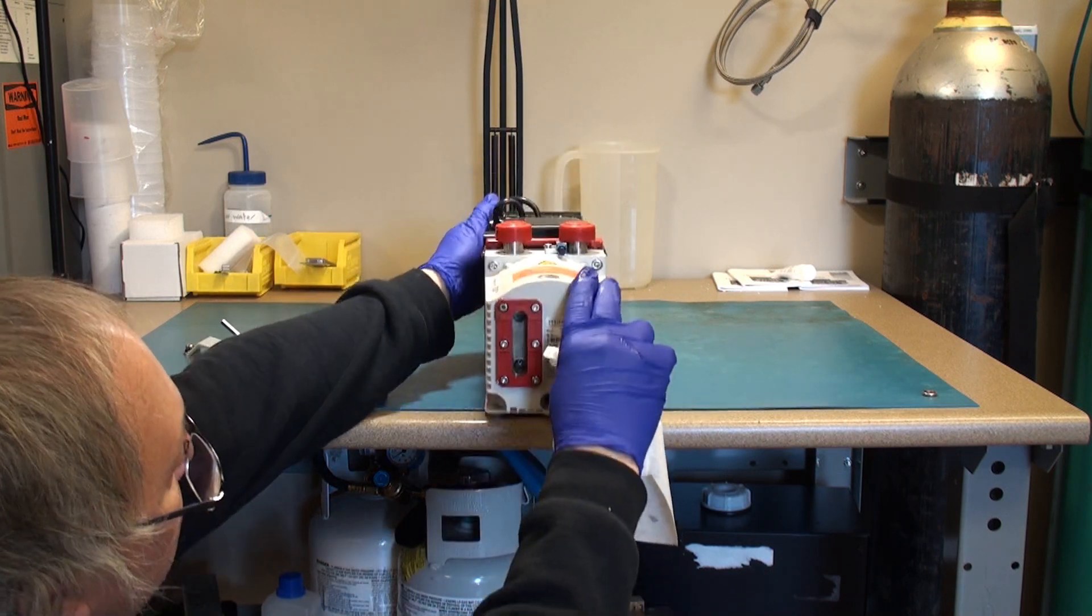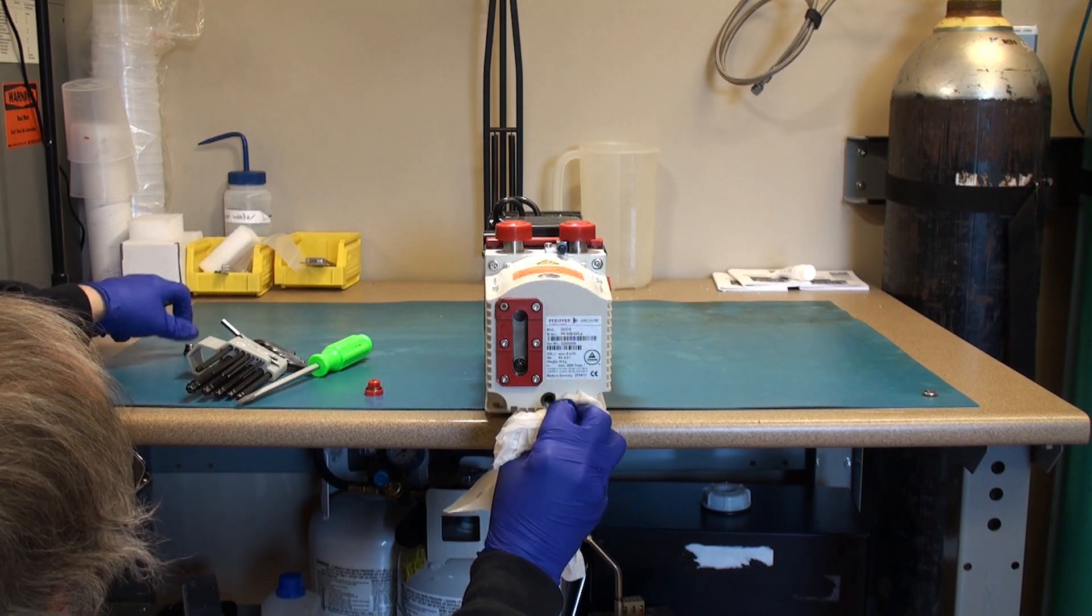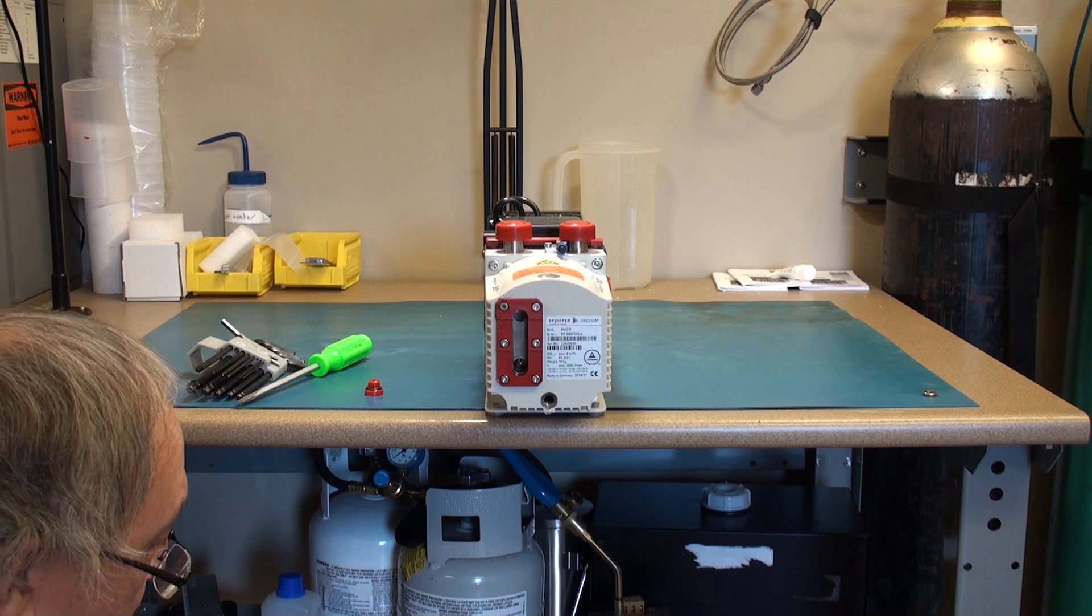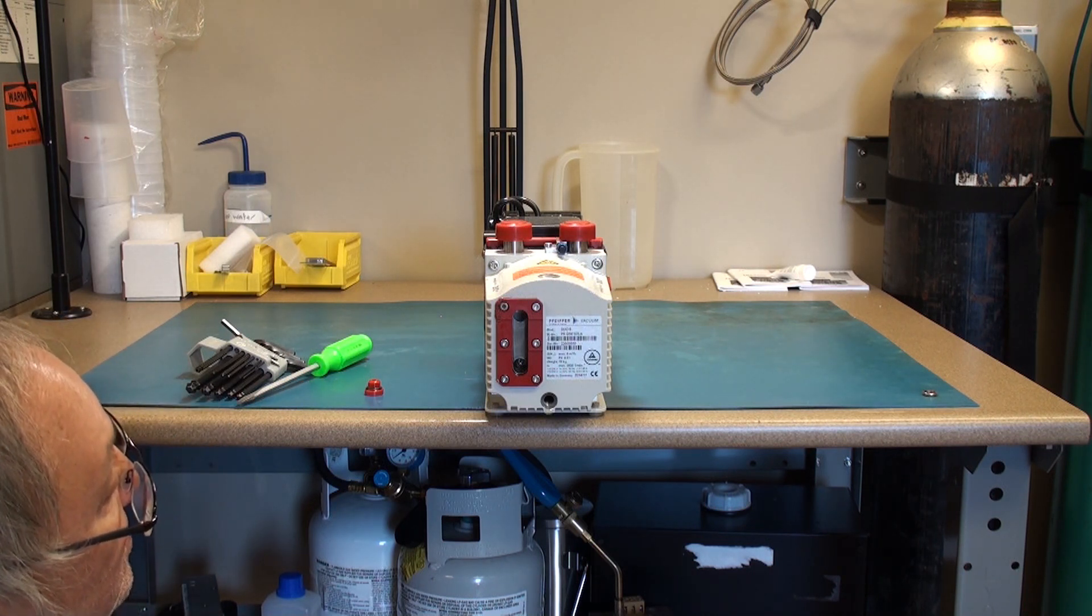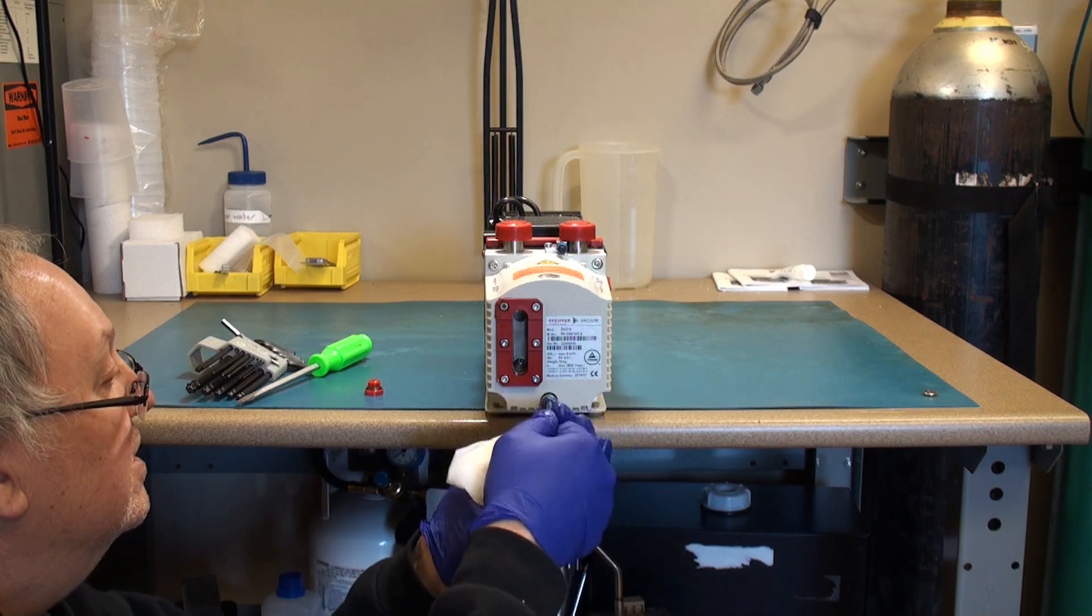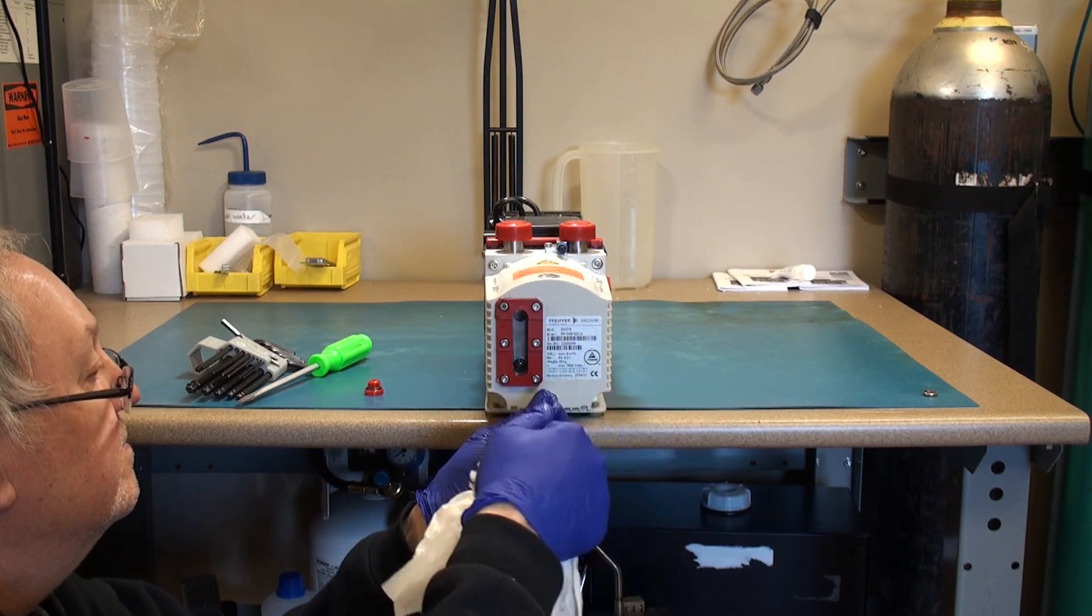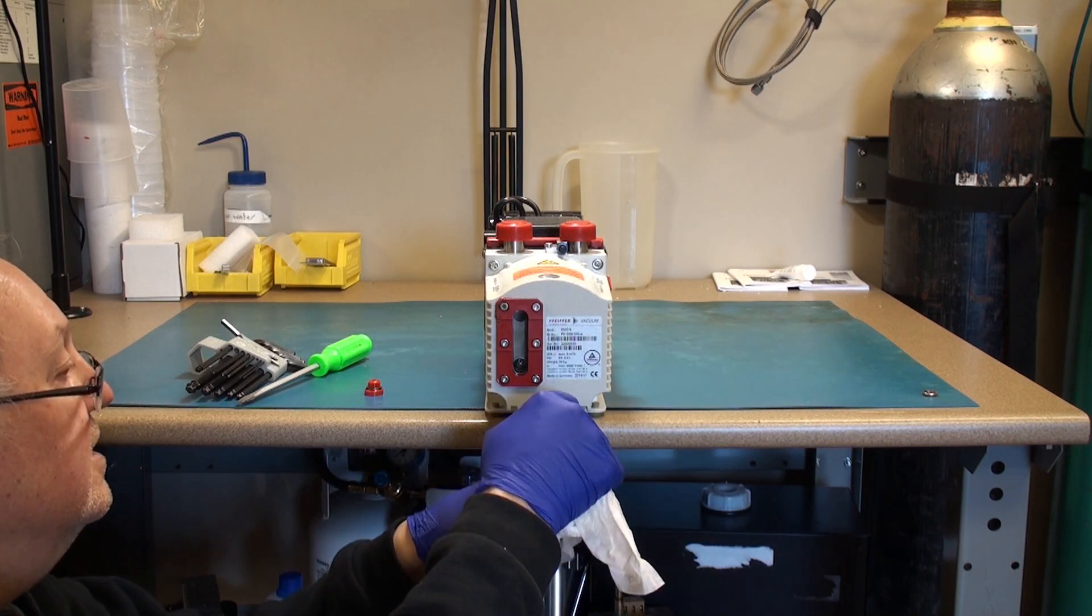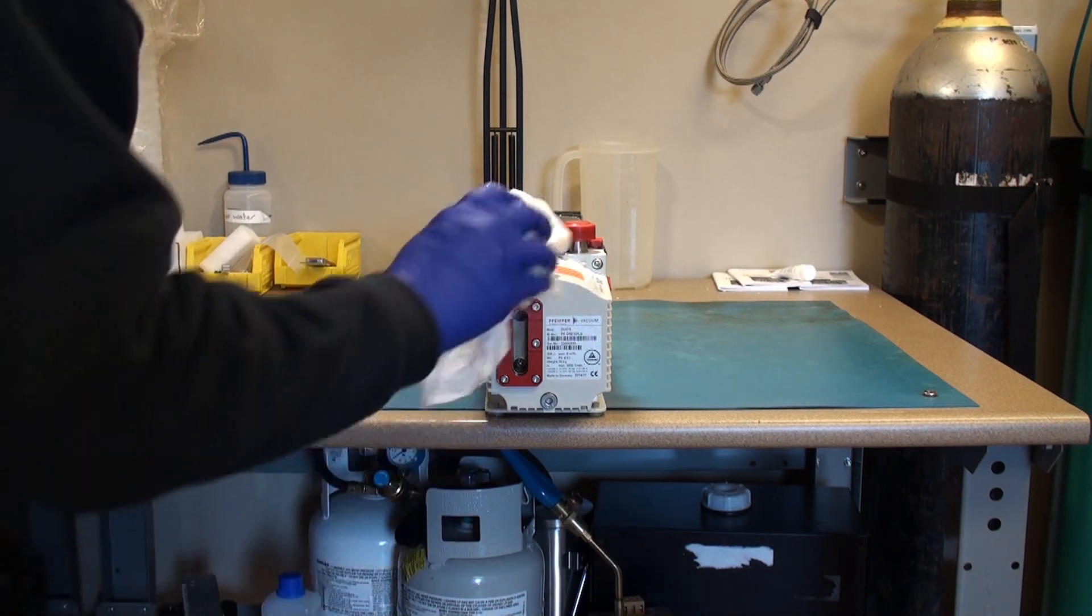Once the pump is drained completely, after allowing it to drip a little bit to get those last few drops, I'll reinstall the drain plug and tighten that down so it's snug. Wipe up any extra oil.